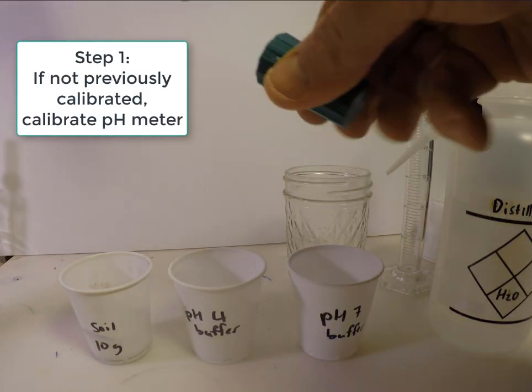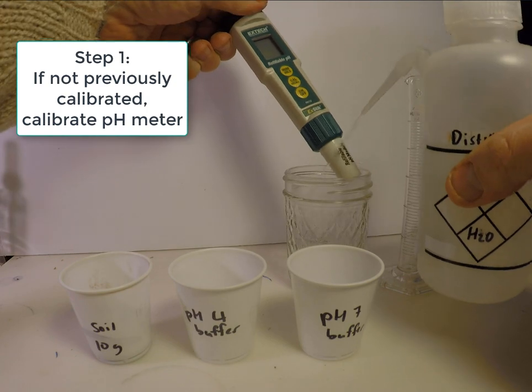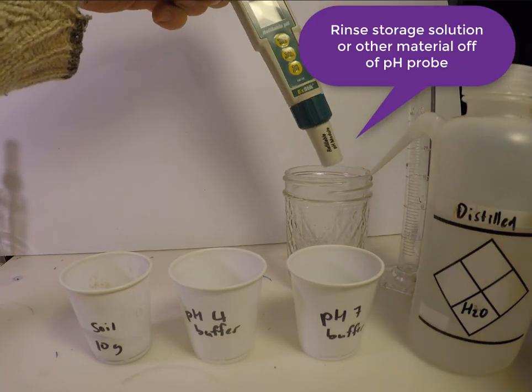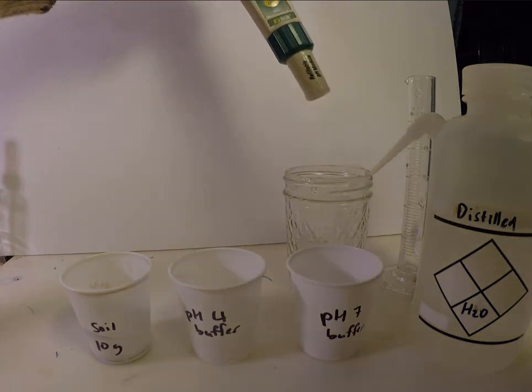The first step for measurement using a portable pH meter is calibrating the meter using pH4 and pH7 buffers. These are also called pH calibrants.